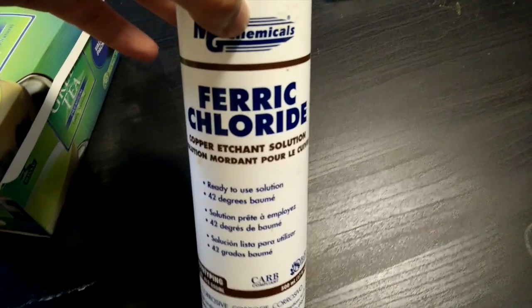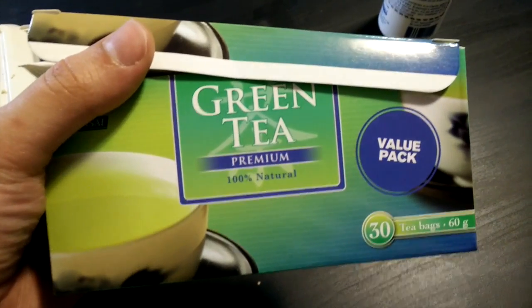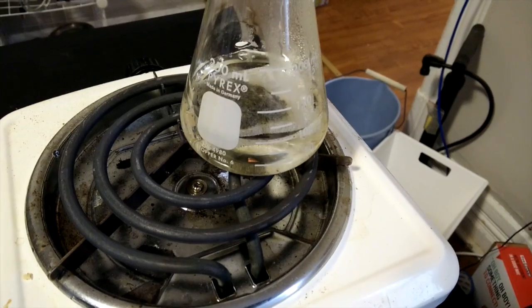To make them you'll need two ingredients: ferric chloride and some green tea. We're going to be using a hydrothermal method so to start we're going to have to make just a regular cup of green tea.